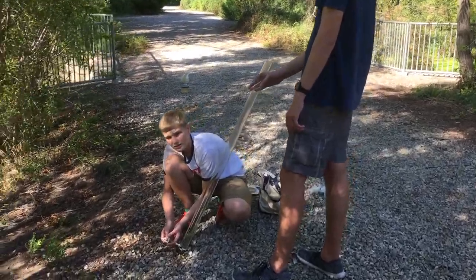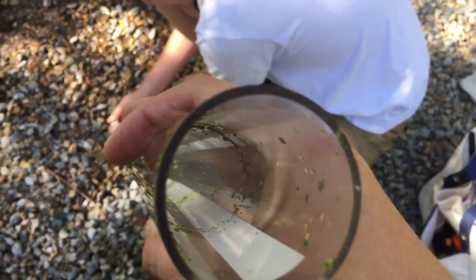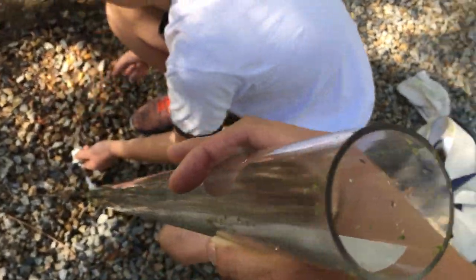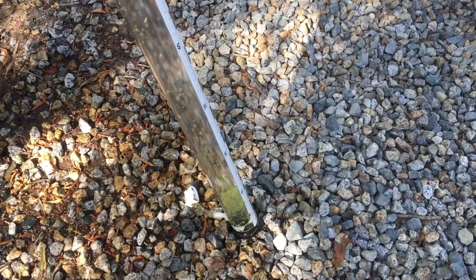Let's see what this looks like. The black and white thing at the bottom — you can see the black and white Secchi disc here. Now we're going to look at the side of the tube, and down there is a reading for the level.